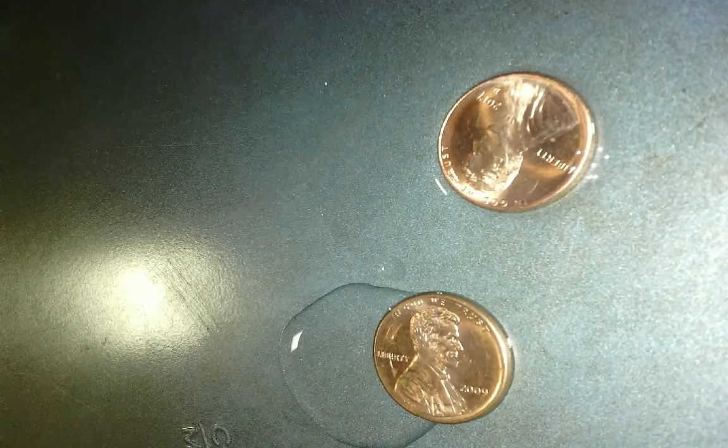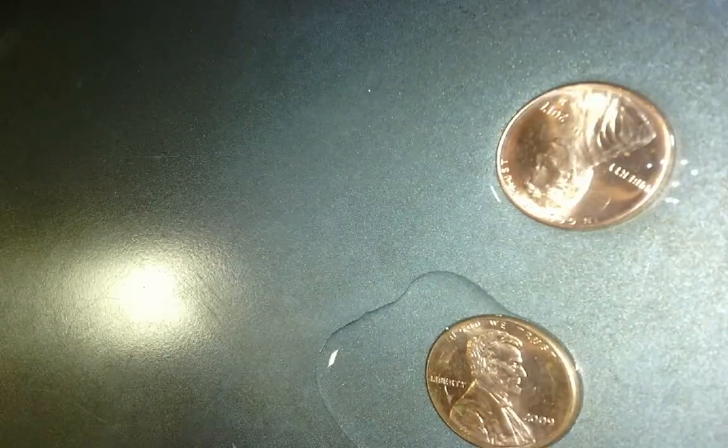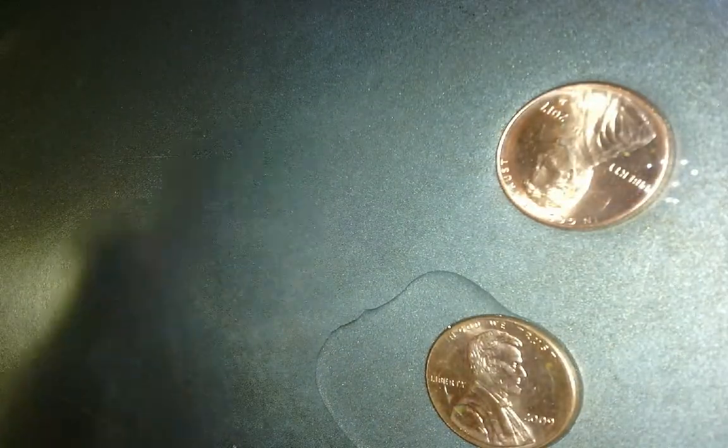So the first part of your lab talks about spreading. Which one spread further? Well, you can see the isopropyl didn't hold as much, so we would assume that would spread farther. And I'm going to move to a new spot. And here is my water. If I just put a drop or 2, you can see it doesn't spread very much. It balls up. It's lovely. My isopropyl alcohol, 1, 2, it spreads much further. And that's part of your data table. And why does it spread further? Because those attractions are much weaker than the attractions in water.